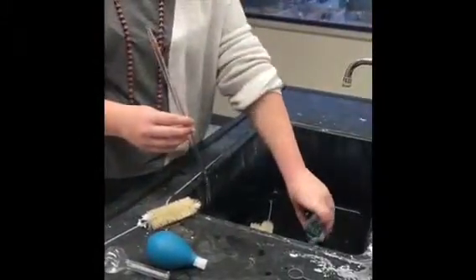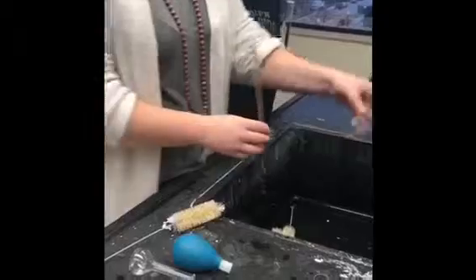When cleaning up after this experiment, all solutions and any other liquids can be poured down the sink. All dried glassware and utensils should be put back where they go. Then you can wipe up. When all materials have been put back up and the surface of your lab area has been wiped down, your experiment is then complete.